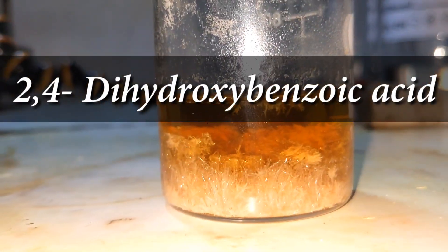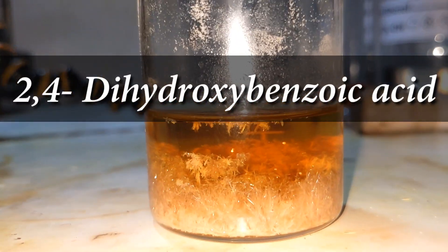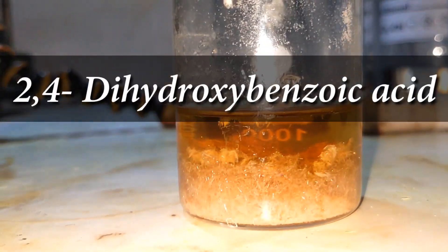Hello friends, in this video we will be making 2,4-dihydroxybenzoic acid by the carboxylation of resorcinol.